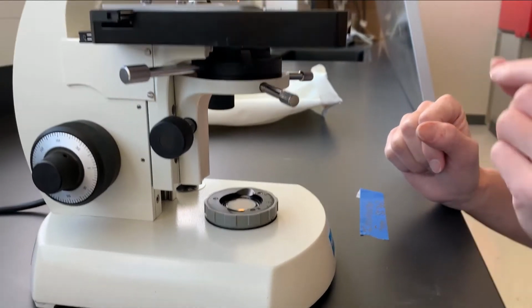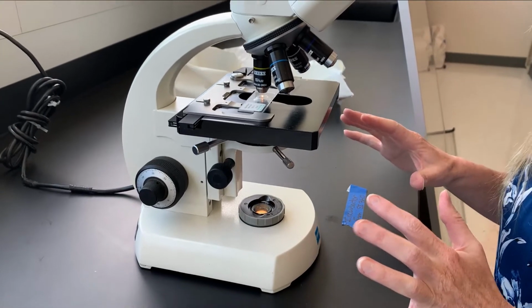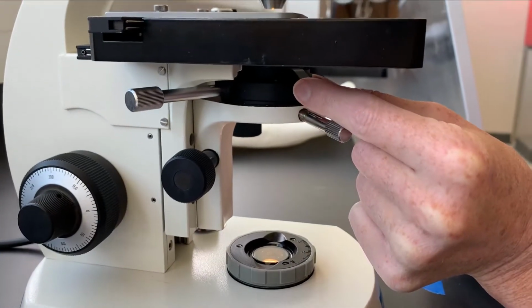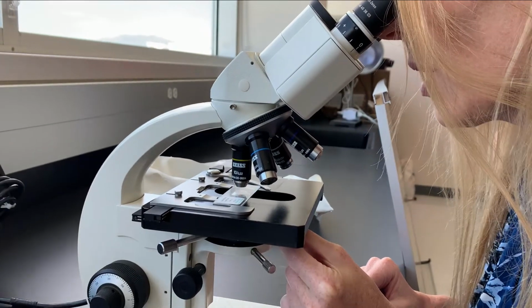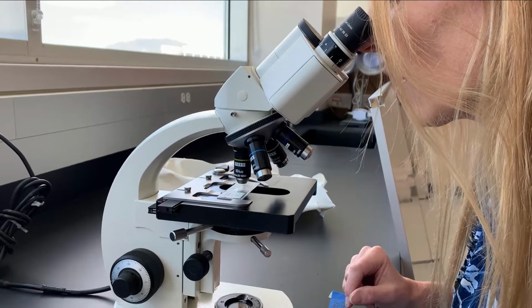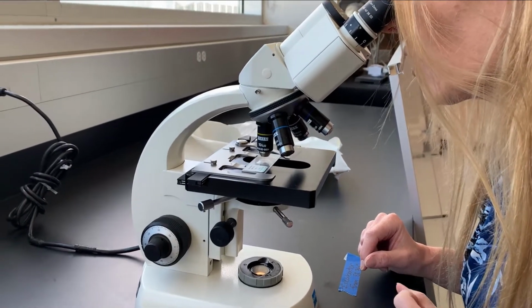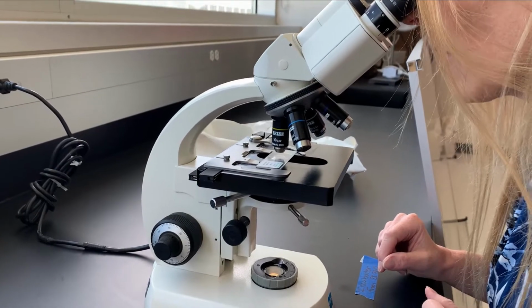The last step for Kohler illumination is, now that we have the brightness set so that our sample is evenly illuminated, we're going to go back to this condenser diaphragm, and once again, looking through the eyepieces, I'm going to start very slowly dialing this down. And what I'm waiting for is for my image to get just a little bit darker and a little bit sharper. This will give us the maximum contrast, so we'll be able to see ultrastructures that wouldn't necessarily be visible if we had that condenser diaphragm open all the way.